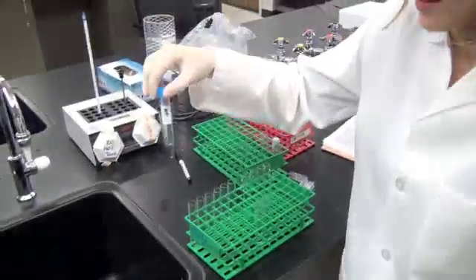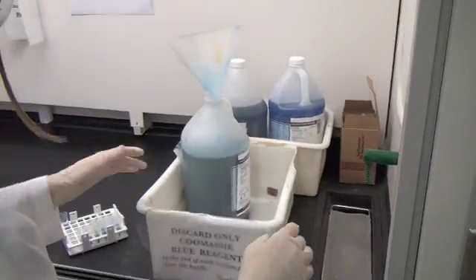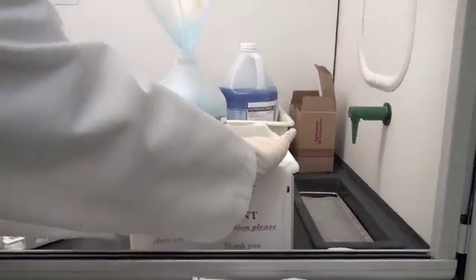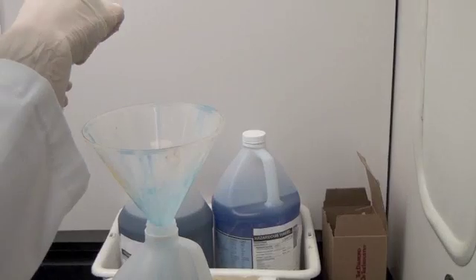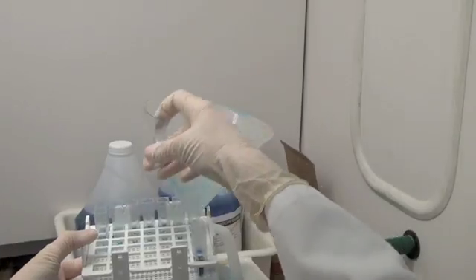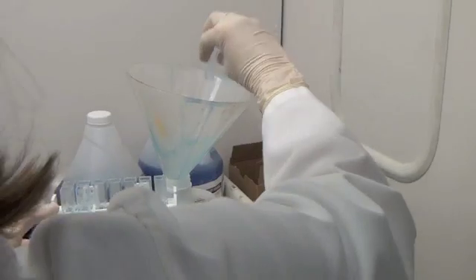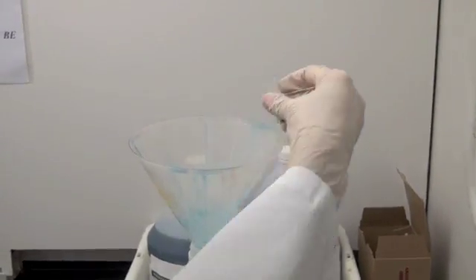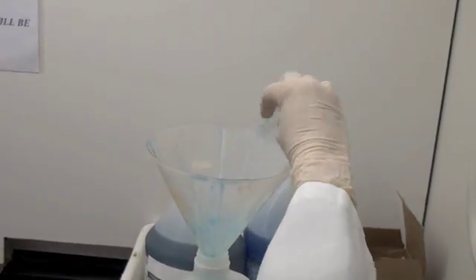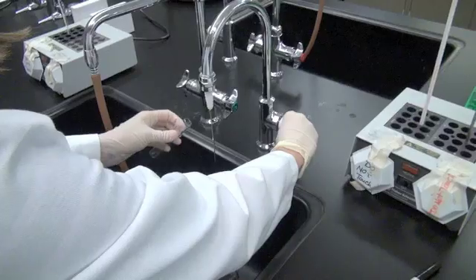Because the dye solutions contain acid, you must dispose of the dye samples into the proper waste containers. Check to make sure that you've removed almost all of the dye reagent from the cuvette. You may then dispose of the cuvettes into the trash, as these cuvettes have now become permanently stained and cannot be used again for future experiments.